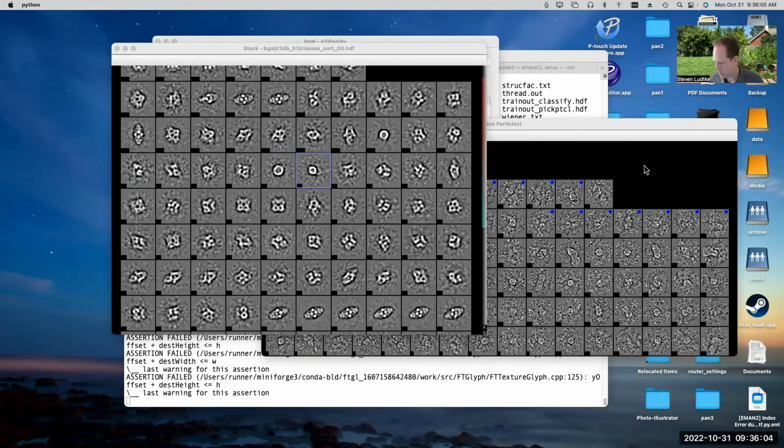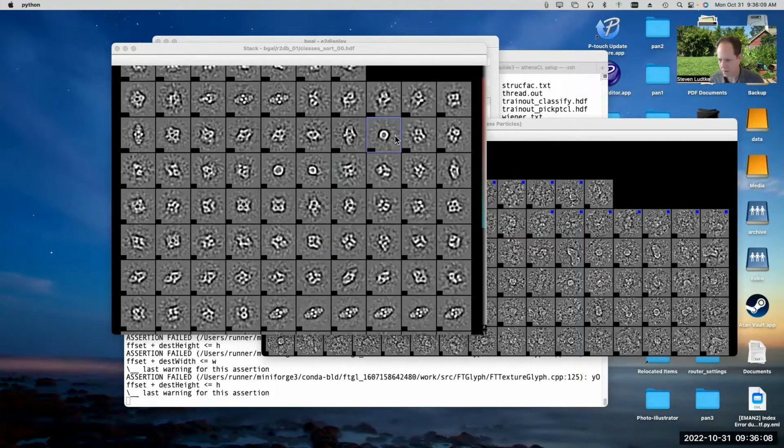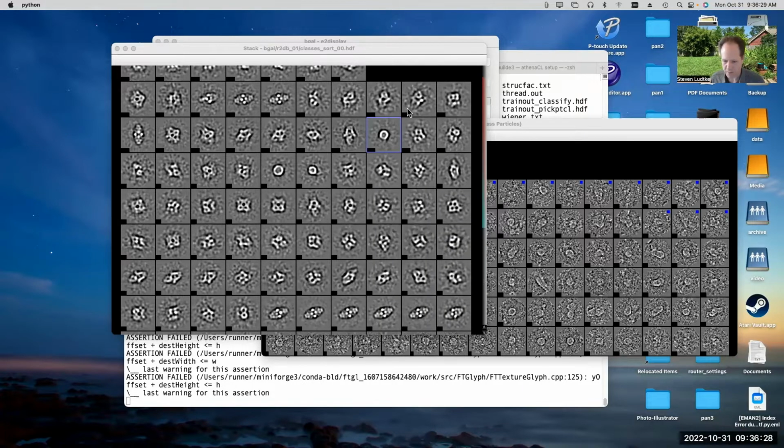We can look at this one, and we can also see that there's a bunch of issues there. This one, again, there's a bunch of bad stuff in there, and it's kind of obvious because of the really high contrast and the funny shapes. The funny shapes are really obvious, but if you see something like this, maybe that's actually a particle. It's just in a particular orientation where it looks kind of like that. That may or may not cause you problems.